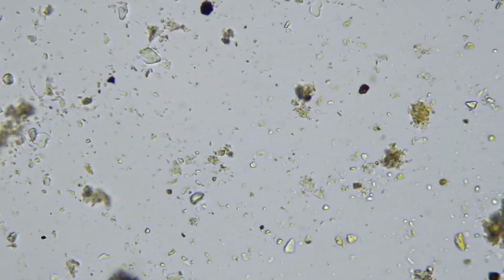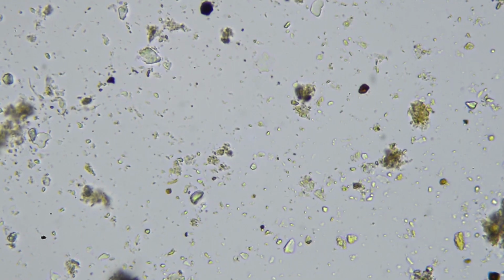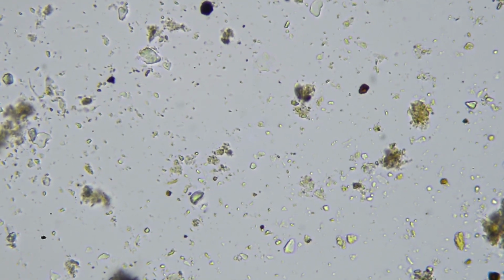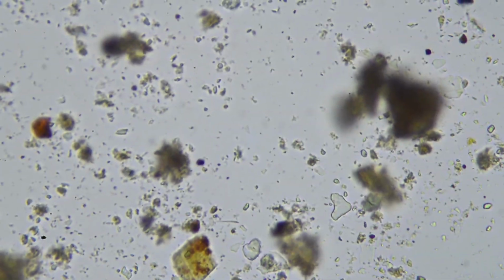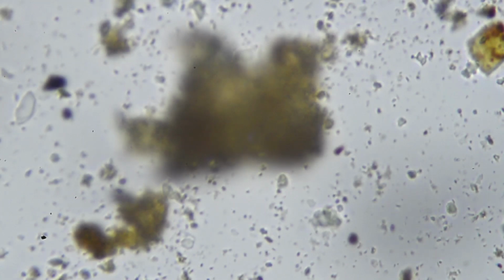So yeah, we want to see high fungal populations, and like I say, that very roughly translates as about seeing 2 hyphae per field of view. So we would have seen a lot of hyphae by now if we had a good fungal presence in the soil. So that might be something to work towards, or see how you can change management to affect that.